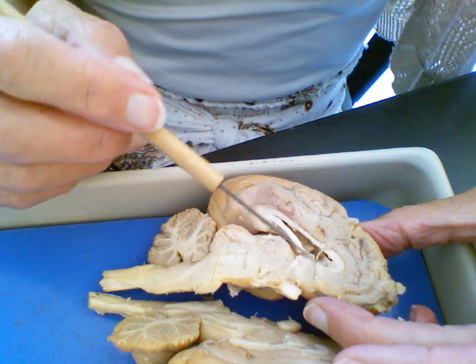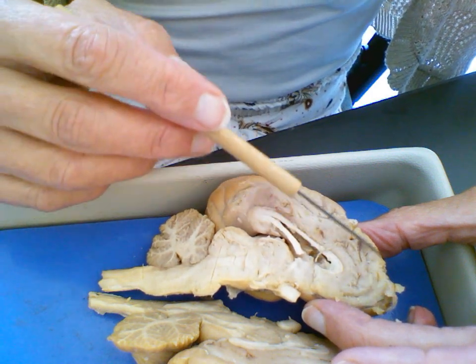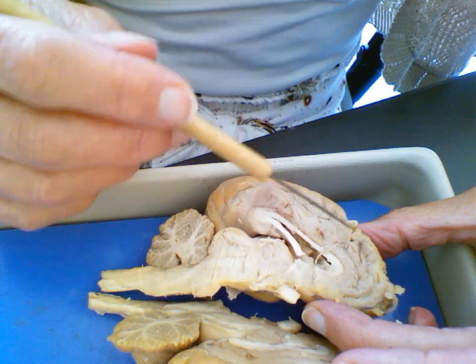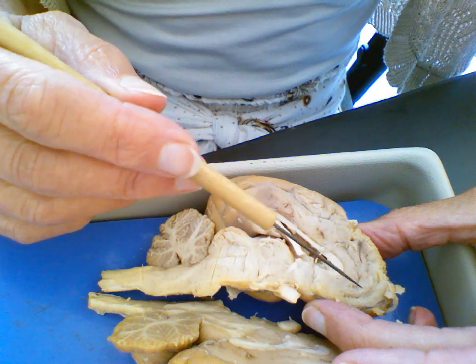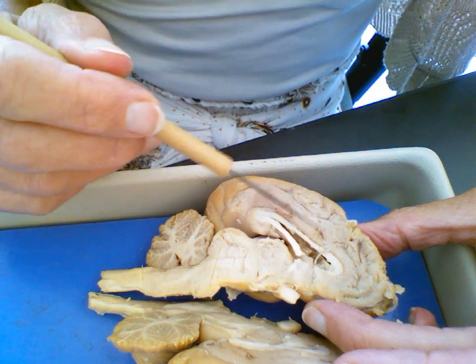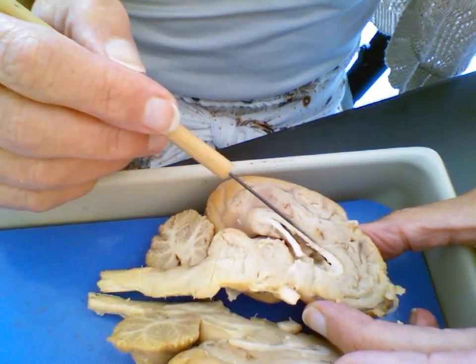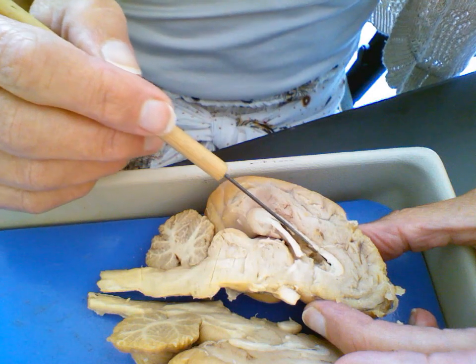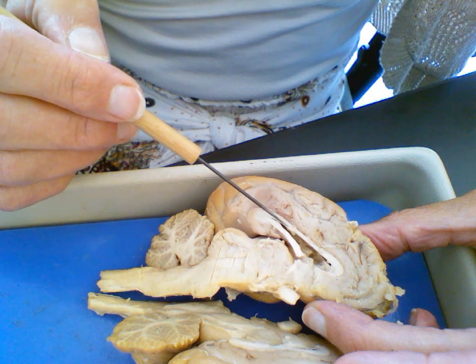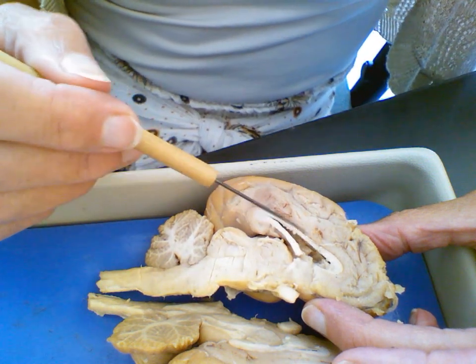So one of the obvious things you see when you open it up is that there are color differences. Remember that this is all the cortex, and some of that cortex is folded in. Some of these gyri are now on the interior, as it's folded in. And what you also see is that this is kind of pinkish or gray, but this part here is much lighter. So this is the white matter. White matter are the long axons, the fibers that work like communication lines between neurons and between parts of the brain.